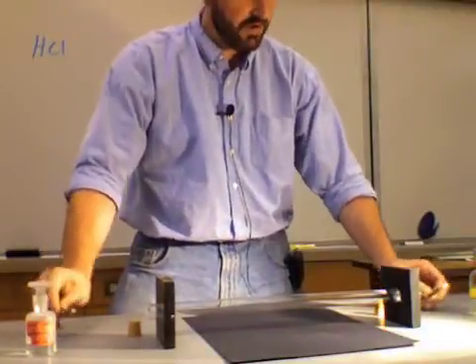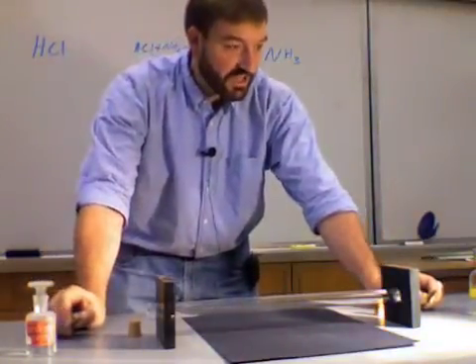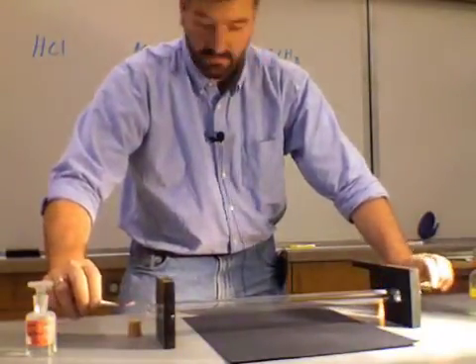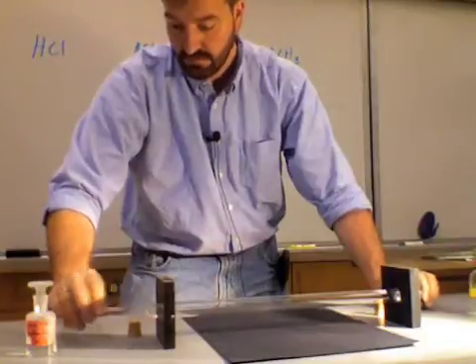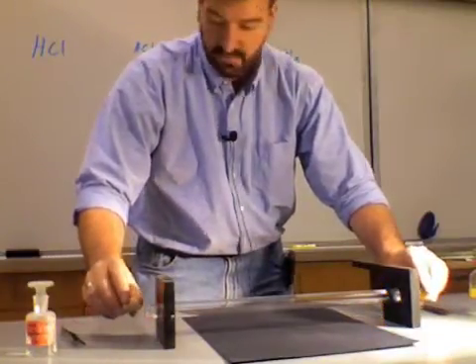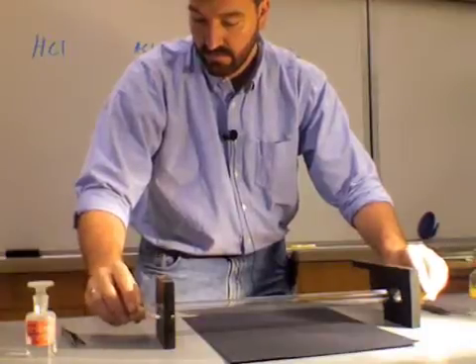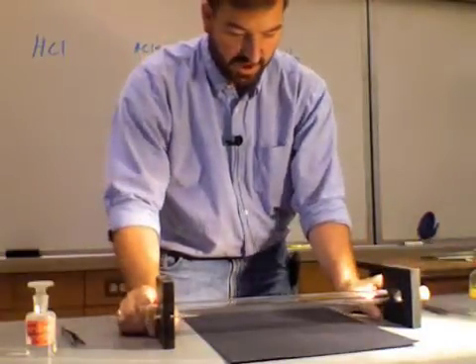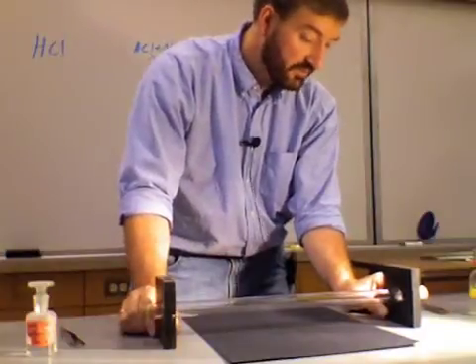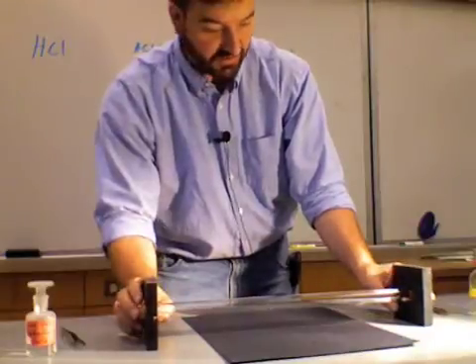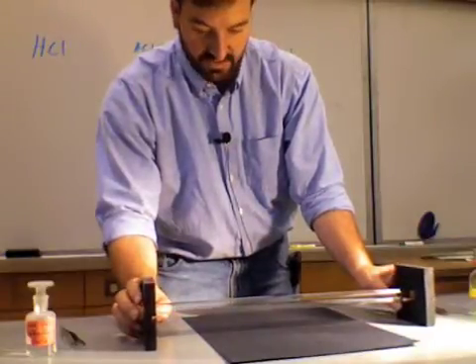All right. So now, I'm going to put these one in each end, and then I'm going to put the stoppers on. Try and put them in at roughly the same time. All right. So we have those in. We have each of those in.